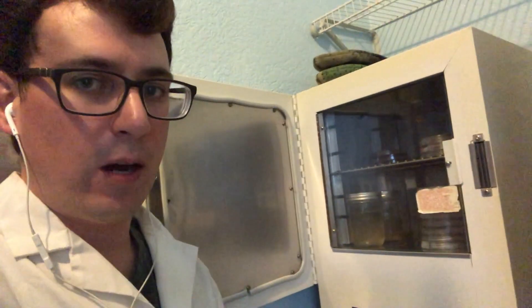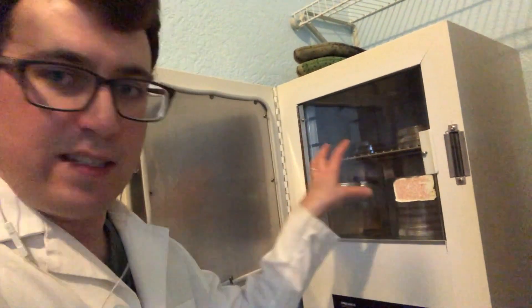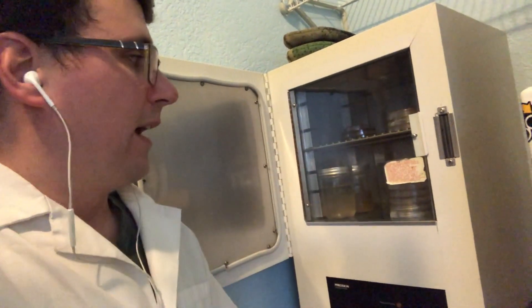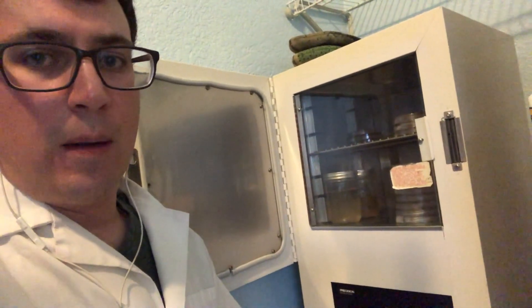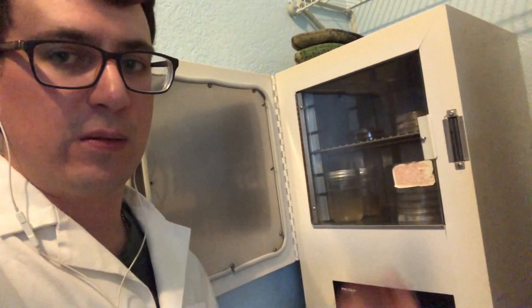I clean it out with alcohol about once a week. And you can see how tight this space is, which makes those little plates even more valuable. Because I'm going to fill this up in like the next 24 hours with isolates.